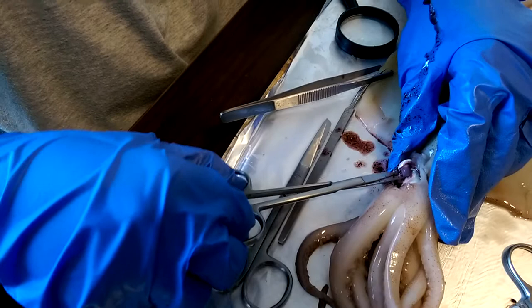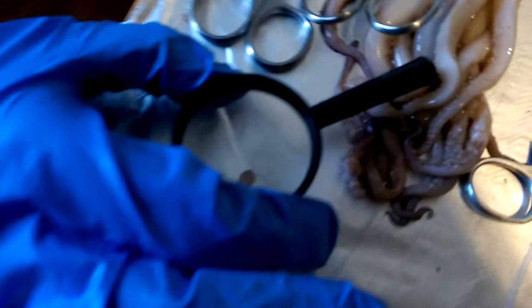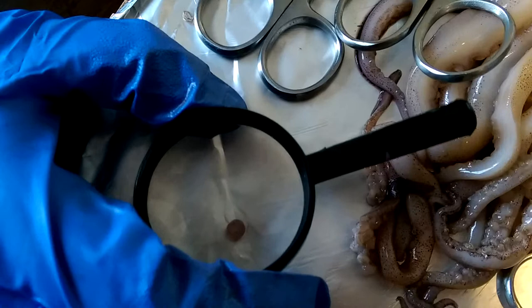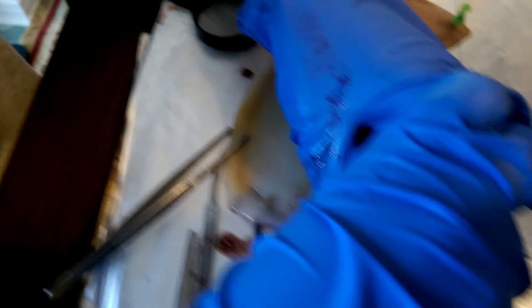Now this is getting a little interesting. The eye is actually... ta-da! Right here, my friends. If you can't see, I'll put my magnifying glass. It looks kind of bluish. There's another eye — I'll leave it for now. This is just a case where the eye stays. If you want me to get to some good stuff, let's begin.